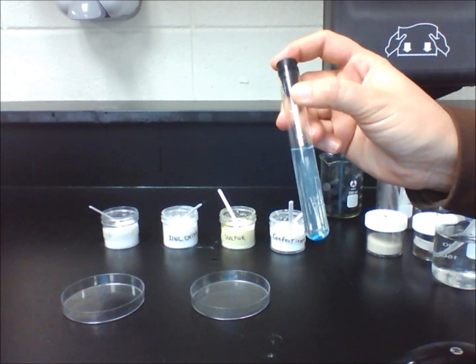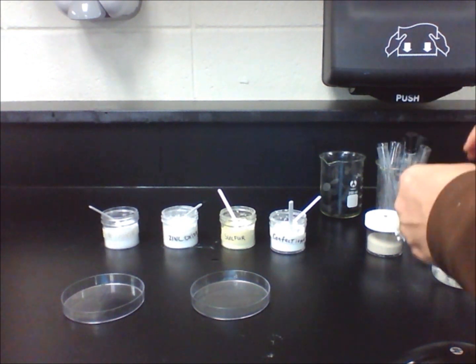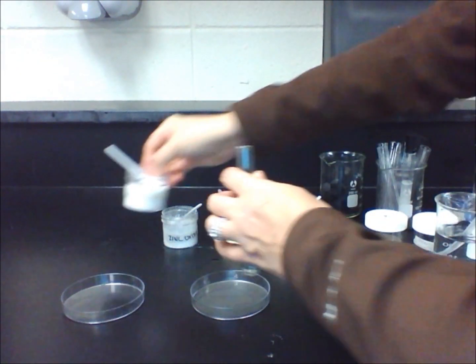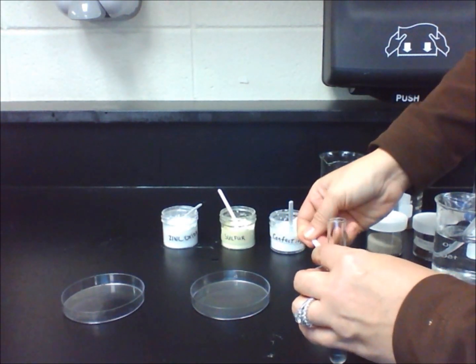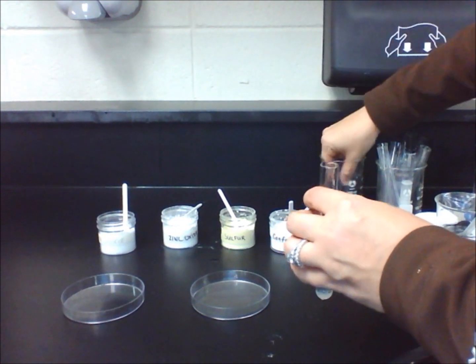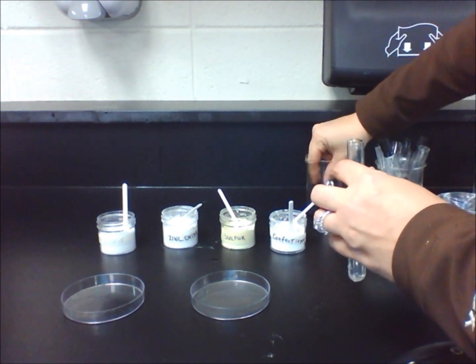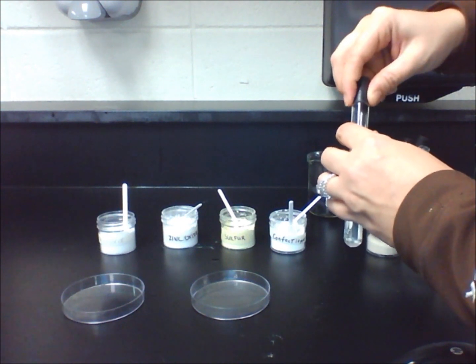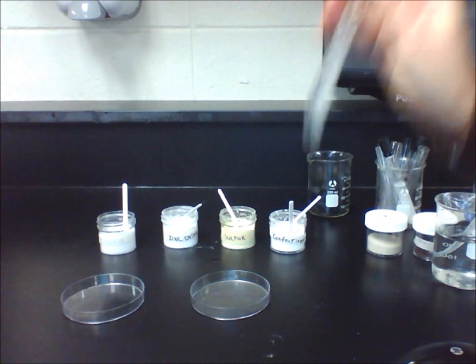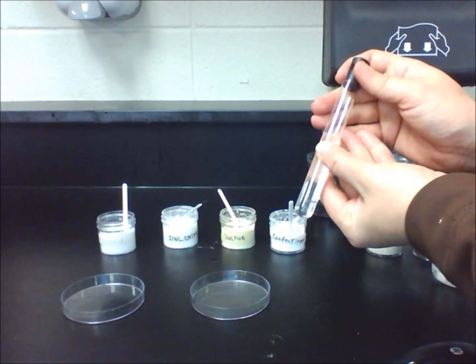Let's now put one lab scoop of sodium chloride into a test tube filled with 5 centimeters of water. After putting a stopper on it, shake the mixture 10 times and record your observations again. None of the solid crystals are visible. The water itself has a slight white color to it, making it appear a little hazy. Therefore, sodium chloride does dissolve in water.